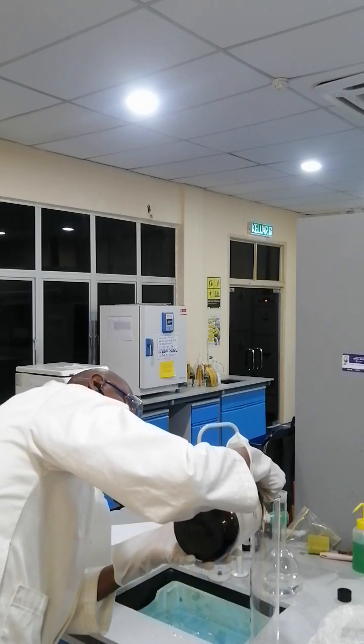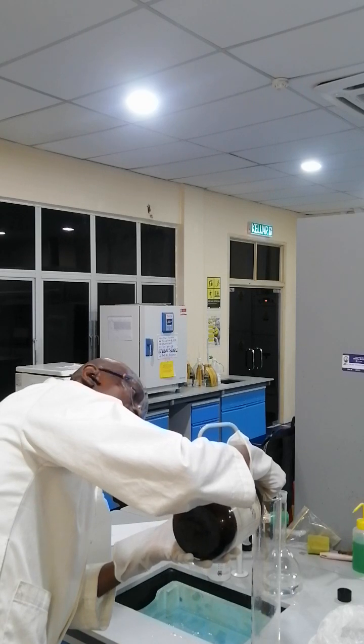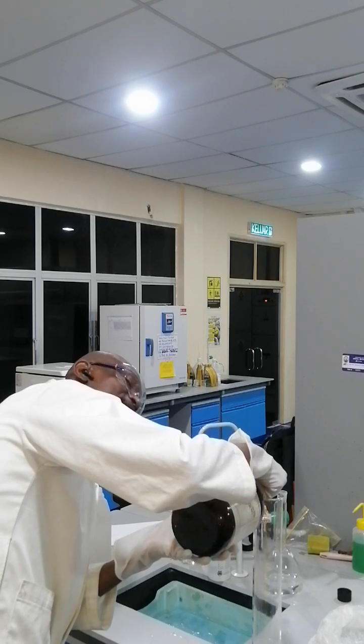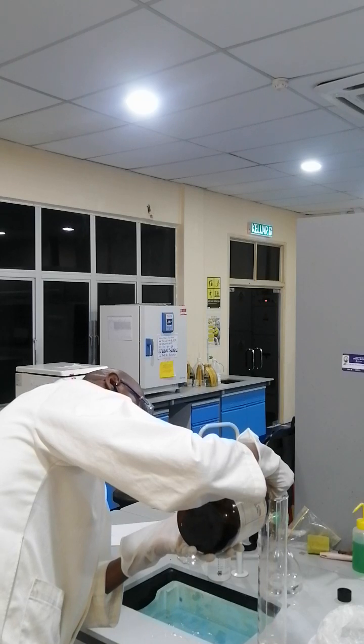We make sure that we are wearing our gloves, PVC gloves preferably, as I'm wearing now. And because the acid also gives out fumes, we make sure that our nose is taken far away from it.